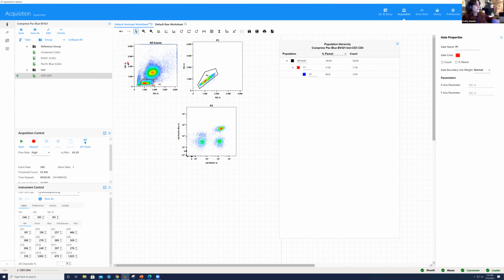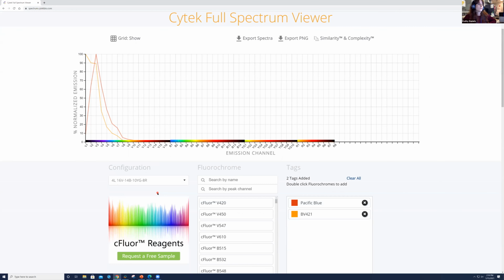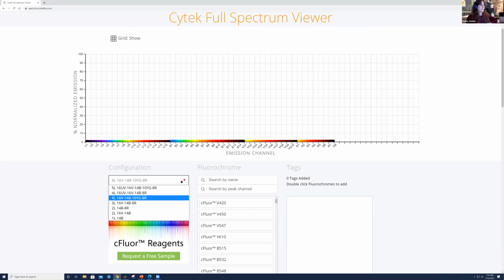And if there are no examples or questions rather, what I'm going to do is go back here to the Cytek full spectrum viewer, because what we want to show next is an example of another combination of fluorochromes that are very similar. So the first thing I'm going to do is get rid of my tags. The second thing is I'm going to change back to my configuration, because I know that I'm on a 5 laser unit, okay?